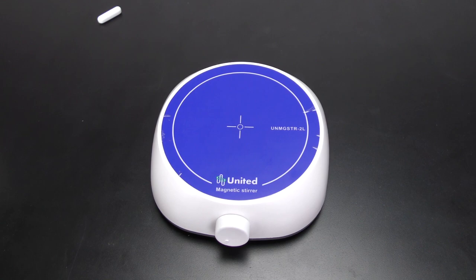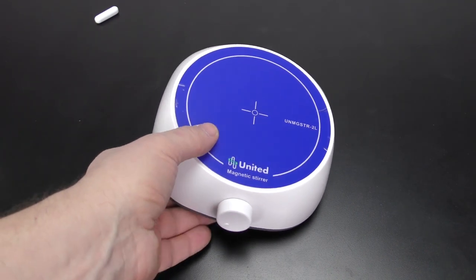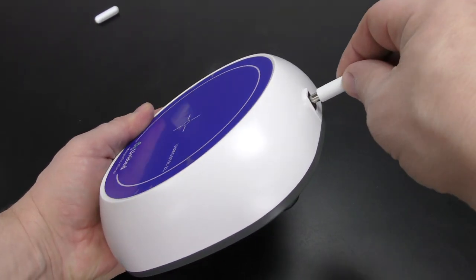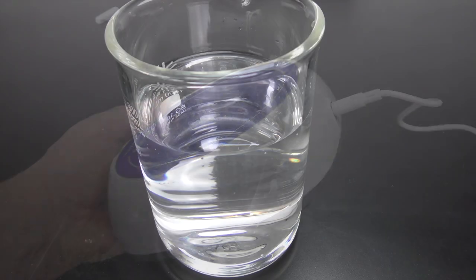Then it's just a few steps to get ready for use. First you plug in the power cord, prepare your solution.